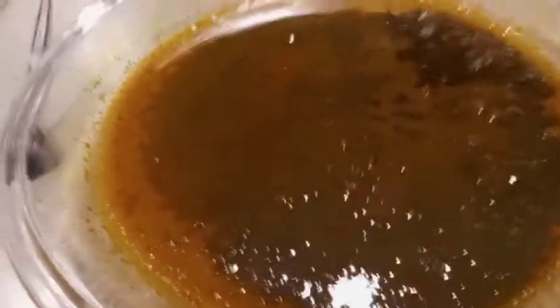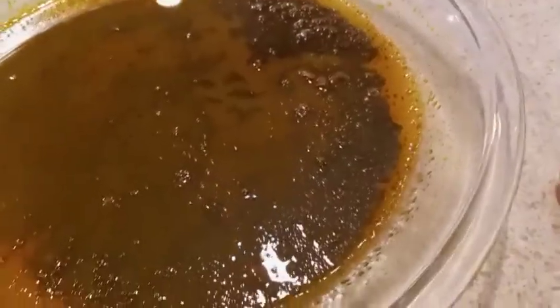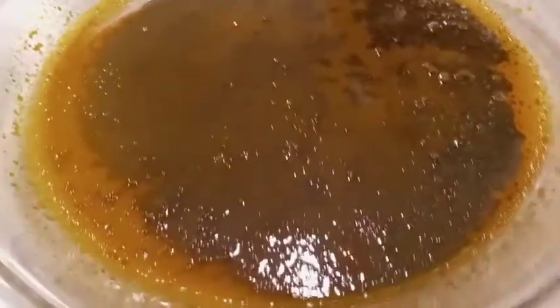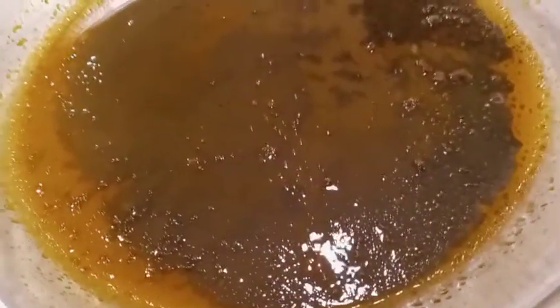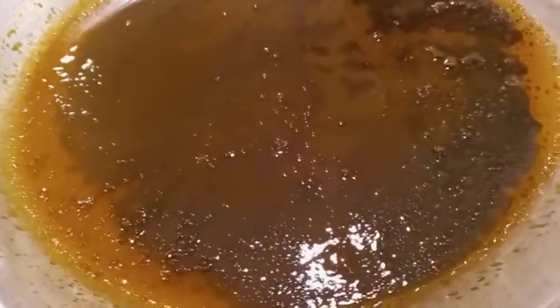This is to show what would happen if you didn't do the potassium hydroxide step. All these oils could have been filtered off — they'd be in salt form as fatty acids — and water could have been added to crash out the piperine. I wanted to show the beginning of this process. It was just a soak with some shaking; no condenser or anything. I wanted to see what the percent yield would be. Total soak time was about one week, then it was vacuum filtered.